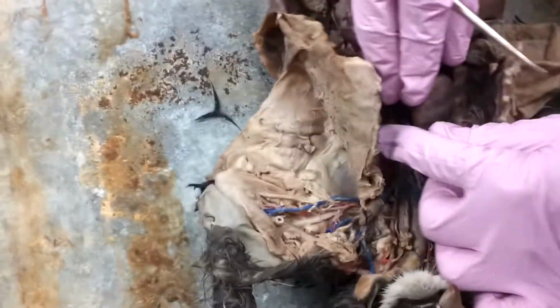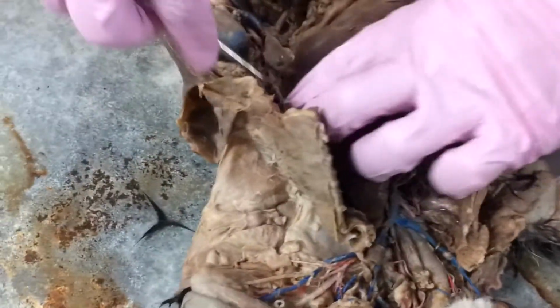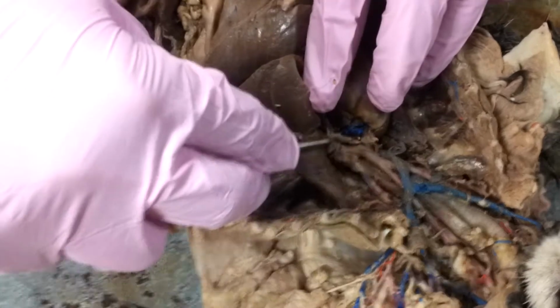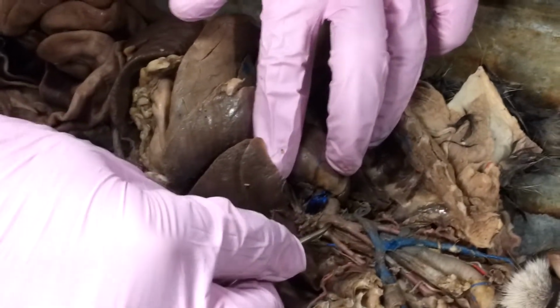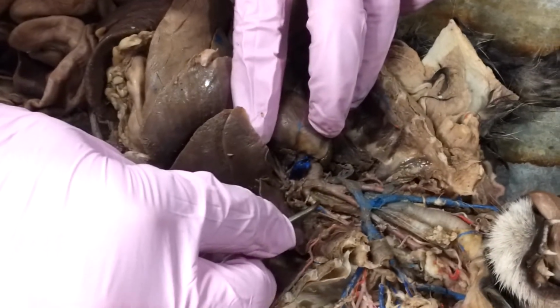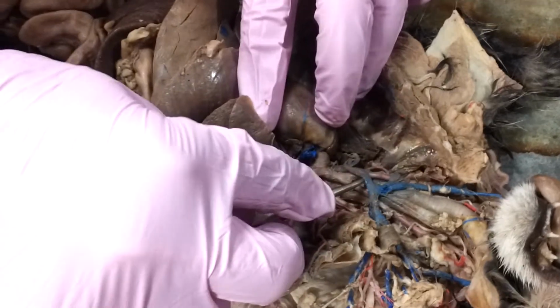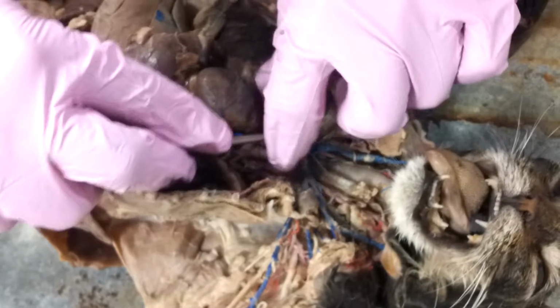And again, first thing we want to notice is this aortic arch. And here's our aorta. If we follow it down, we can see here's the whole descending aorta. But let's stick with that aortic arch. And really nicely dissected, we've got two branches, brachiocephalic and left subclavian. Perfect, right here.